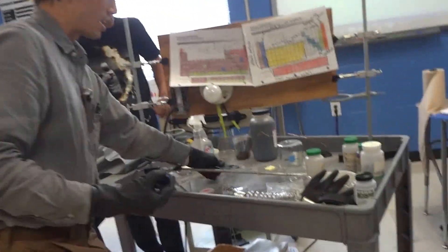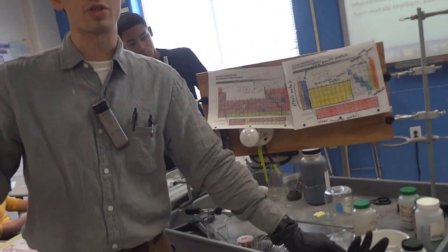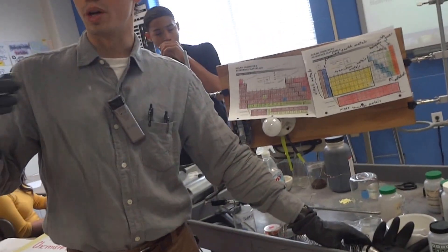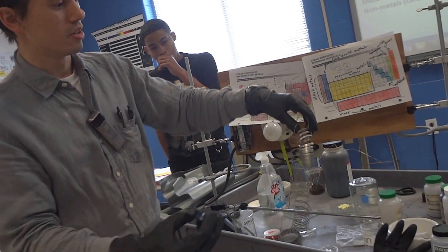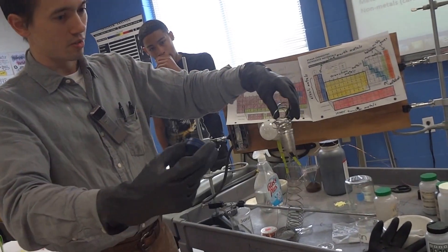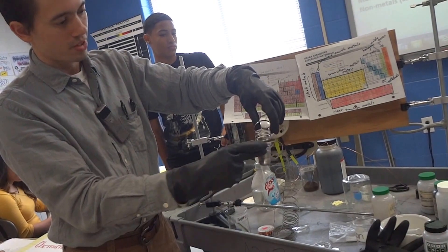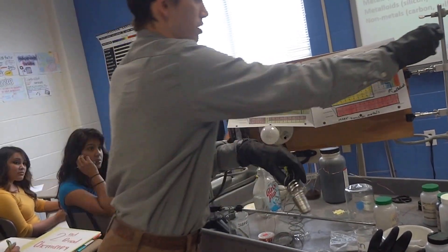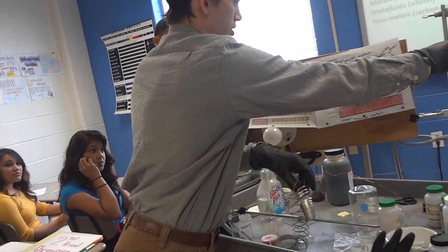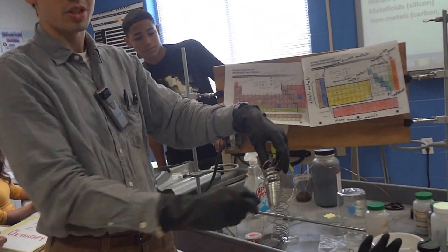Now we're going to test magnesium. Magnesium and iron were both conductors — are they both magnetic? Let's see if I can attract this magnesium slinky with the magnet. It's not sticking — this is not magnetic, whereas the iron sticks right away.